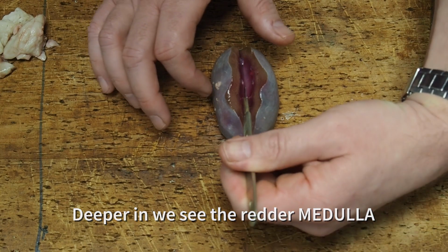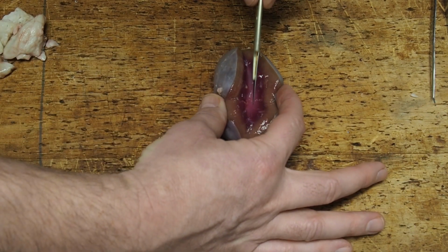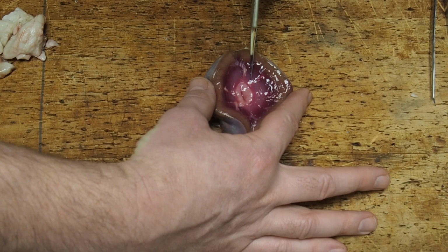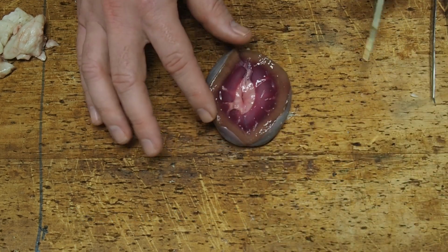Now, starting to appear through the pinkness of the medulla, I can see another even paler layer, and as I go through the last little bit of medulla, we'll see down into the white inner side of the kidney, which is called the pelvis. Not to be confused with your hip bone, this is a different pelvis.